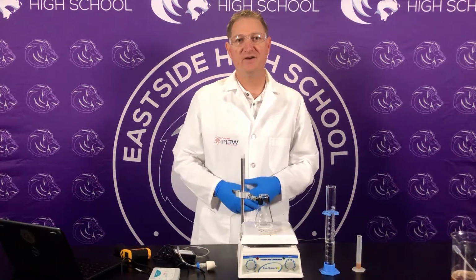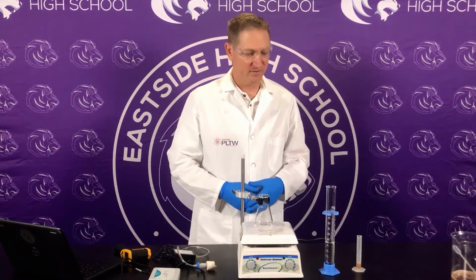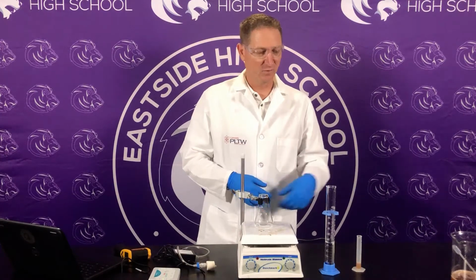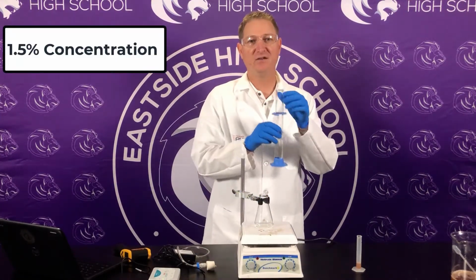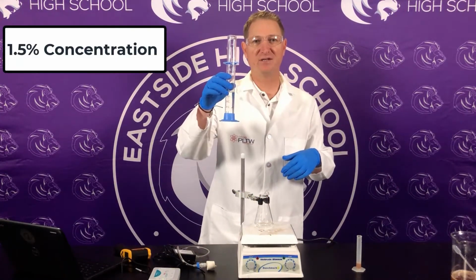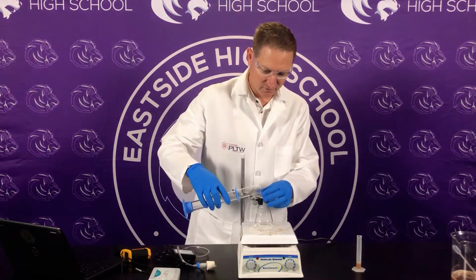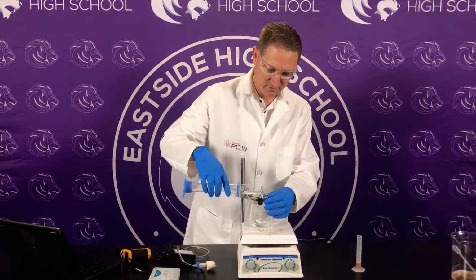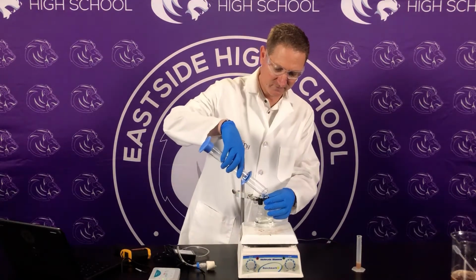Okay, so we're going to use the variable of concentration on this particular lab. If you chose concentration as your variable, we're going to use 1.5%. Remember, last time we used 3% H2O2. So I'm going to pour this 50 mLs into the flask.